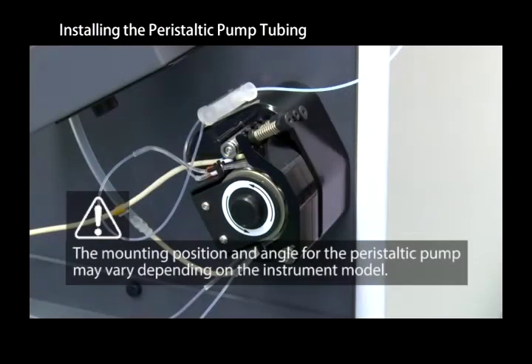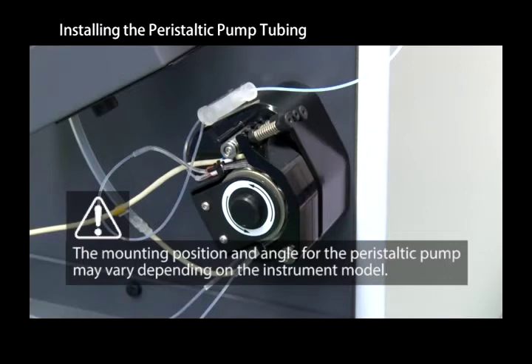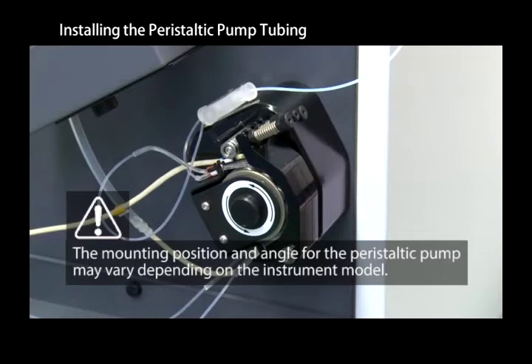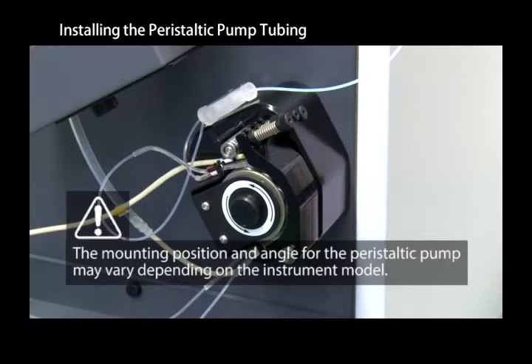We will demonstrate how to connect the peristaltic pump tubing to the peristaltic pump and show you how to adjust the tension.